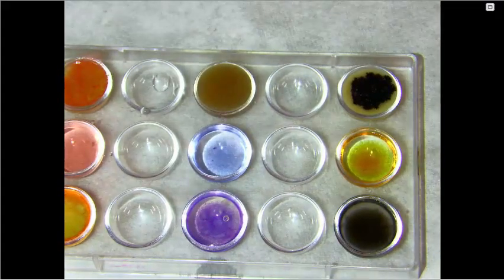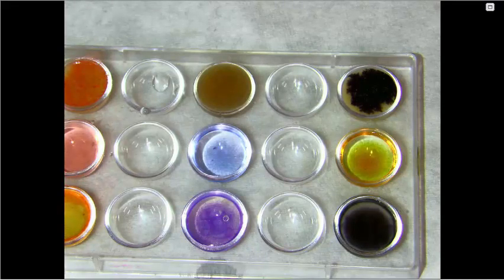In the known positive test, so in the starch solution on the bottom, it turned a black color. In the known negative, so in the water, it turned an amber color. And in the McMush, it also turned a dark black color. This tells us that the McMush solution must contain polysaccharides.